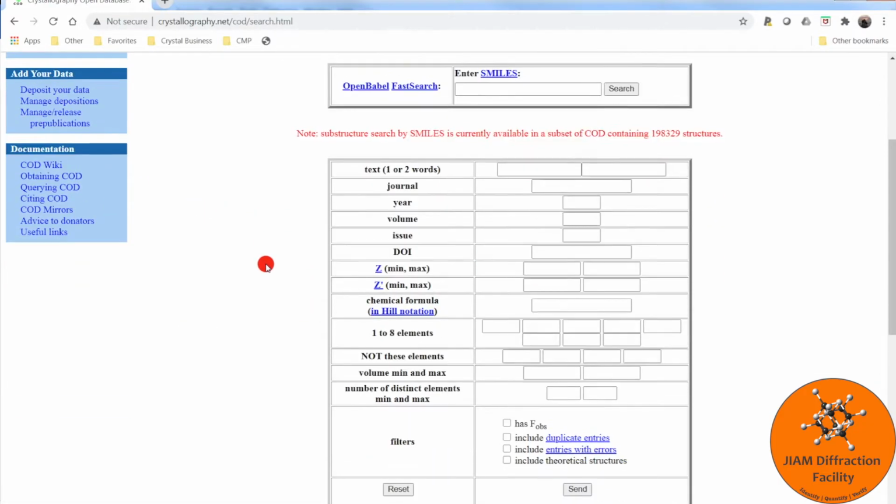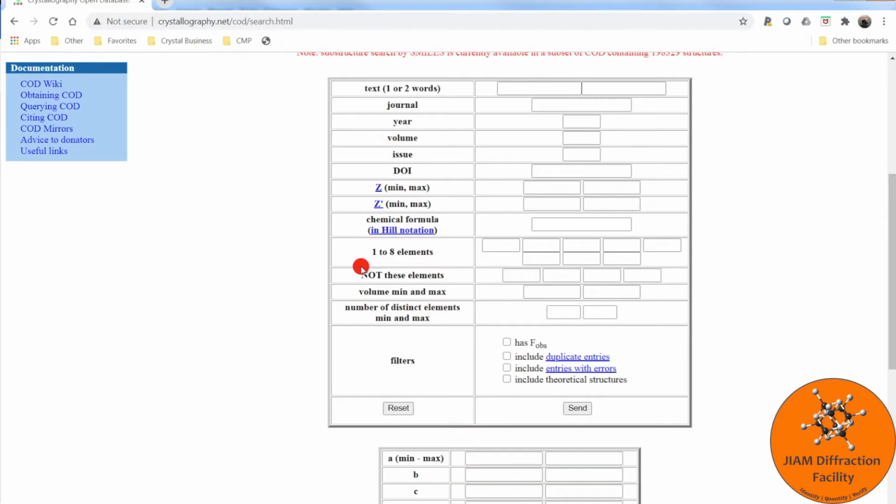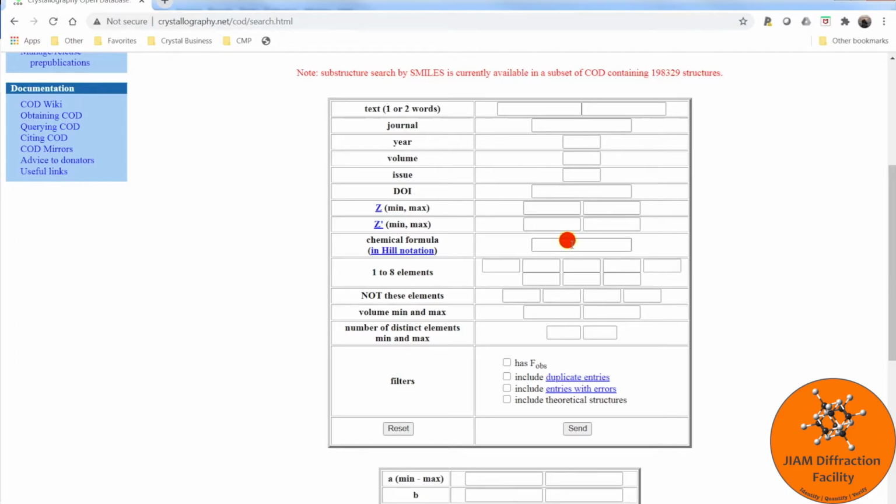We see a number of fields here that we can use in order to search for our CIF file. I will just use the chemical formula, choose silicon, and then send.